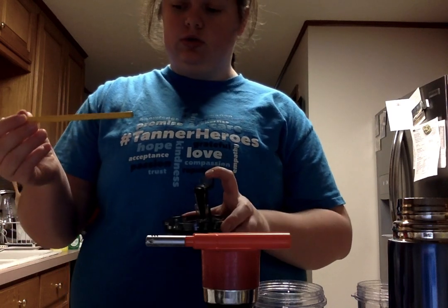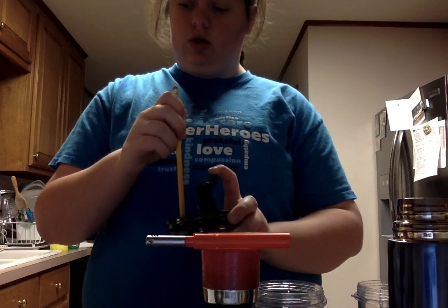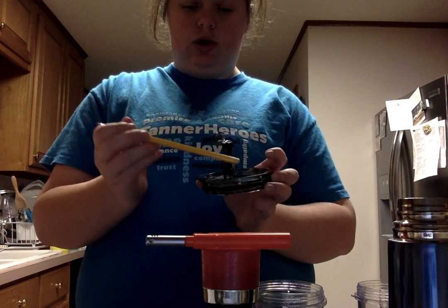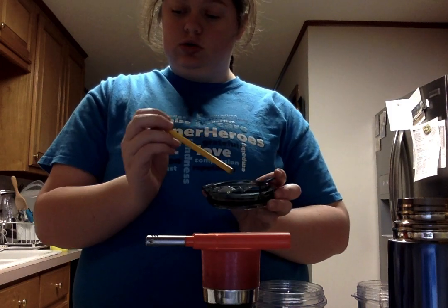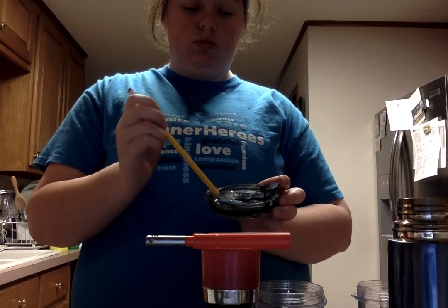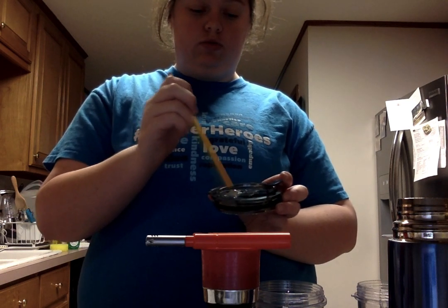To go ahead and quicken the reaction, you're just going to stick it down into the agar. Then I'm going to rotate it, pull twice, and start on the second sector. I'm going to pull from Sector 1 twice and pull the bacteria around that agar for the Petri dish.